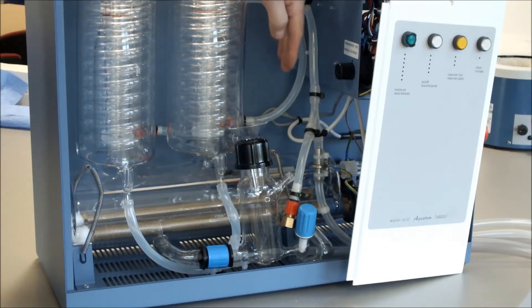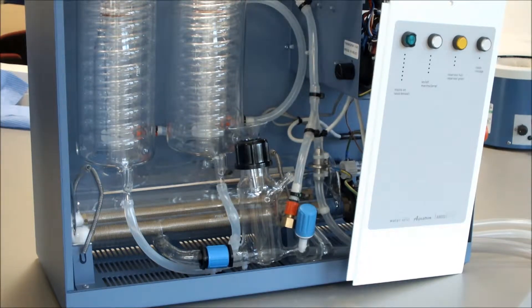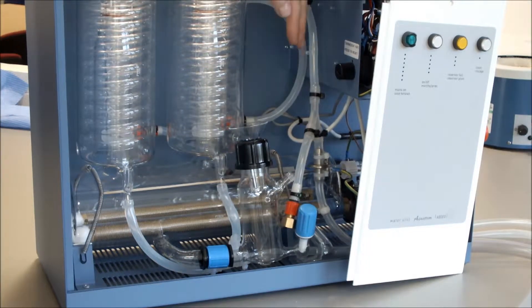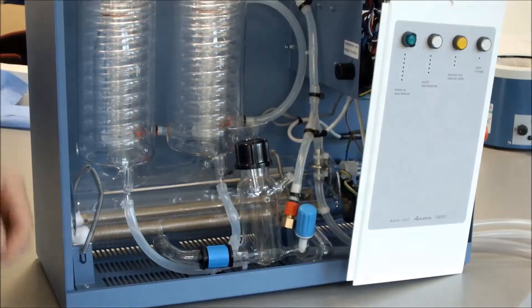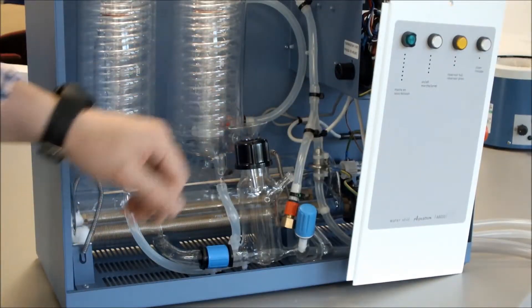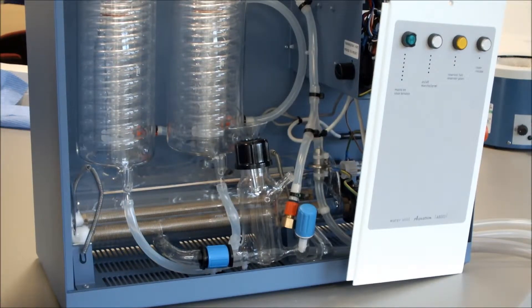The cold water will then come up through the condensers, come out the top of the condensers, down, and then out to the drain. That will then create our cold water atmosphere inside our condenser.